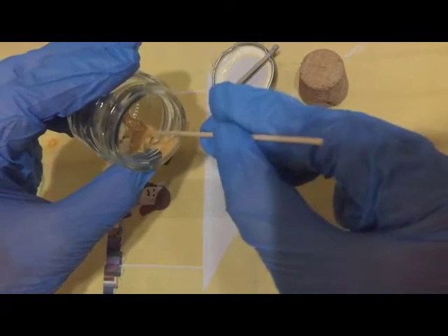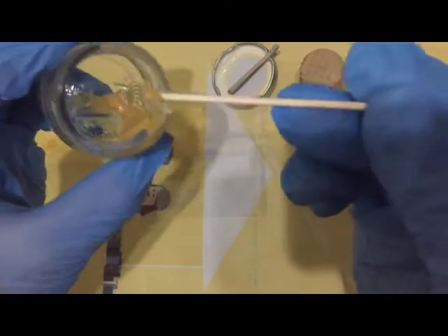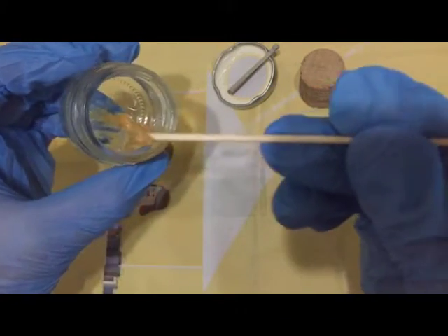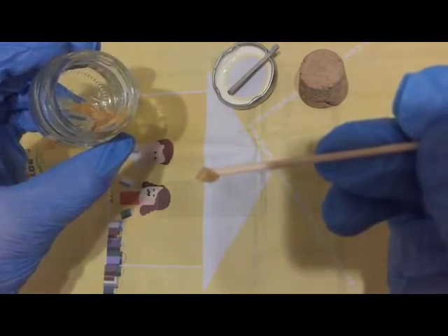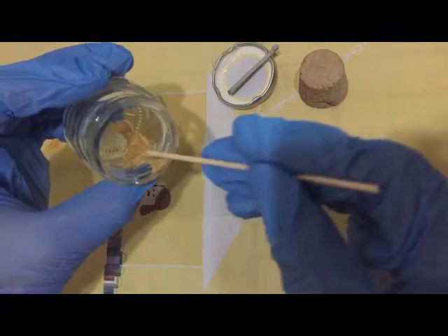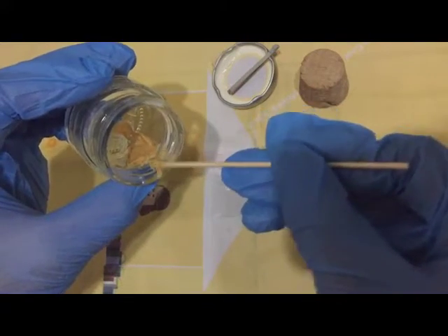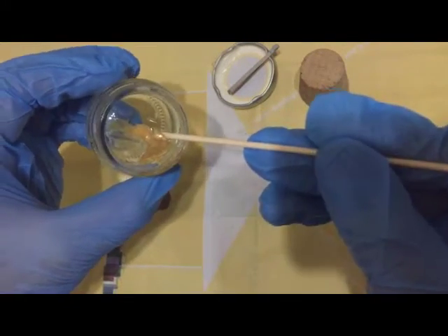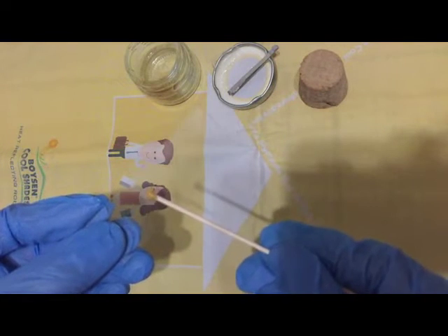As you can see, we're using a little bit more stool sample than the direct fecal smear. Let's get a little bit more sample here, then place it in the center of your glass slide like so.